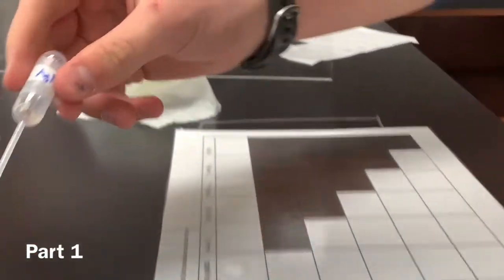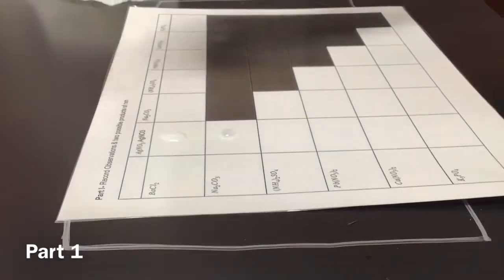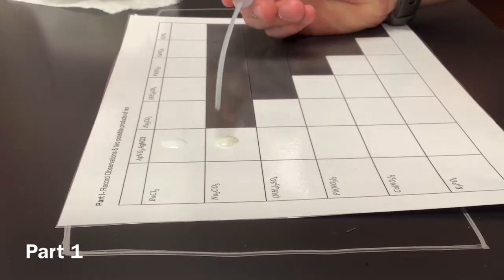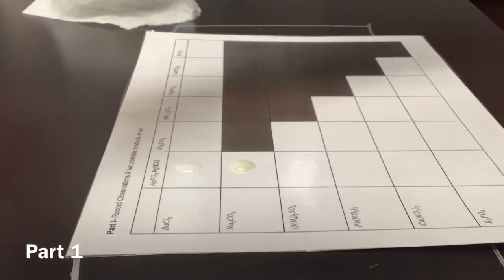Okay. Now we're just gonna do a bunch of the reactions and not take too many breaks in between. Here we go. Let's get an epic angle. A top down. Okay. Let's see if we can get this top down. Na2... Oh no, the lights. Do you multiply? Is it just minus? Okay. And then AgNO3. The super expensive stuff for literally no reason. Is it really expensive?